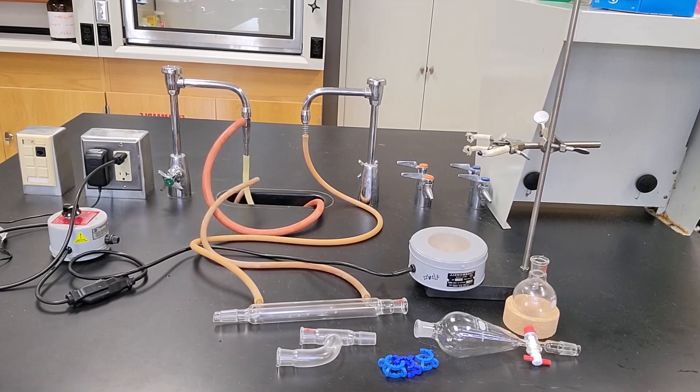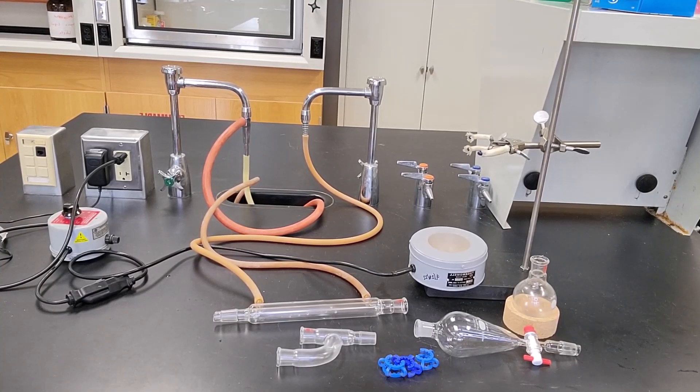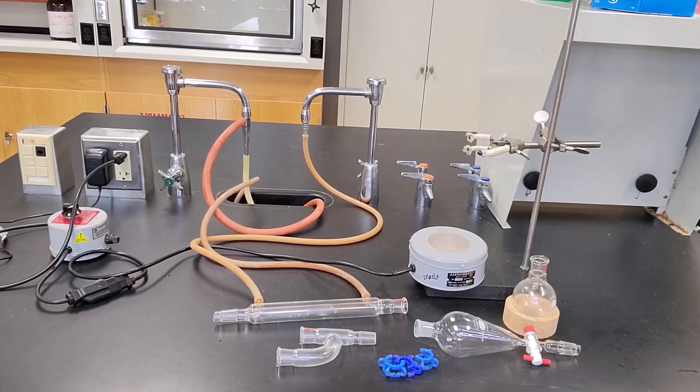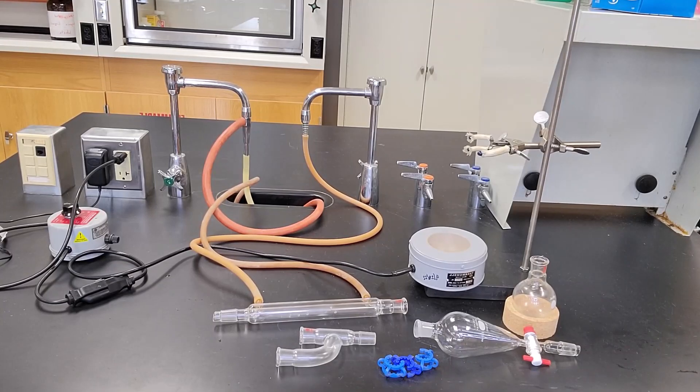In this video I'm going to show you how to set up and use an addition funnel and an addition funnel coupled with a reflux condenser.